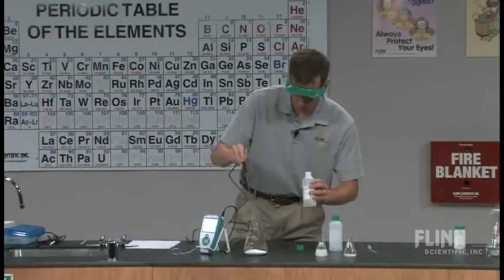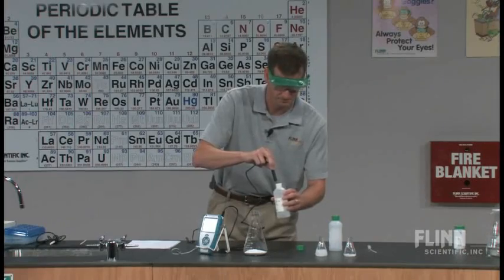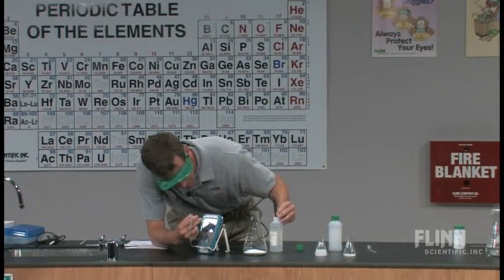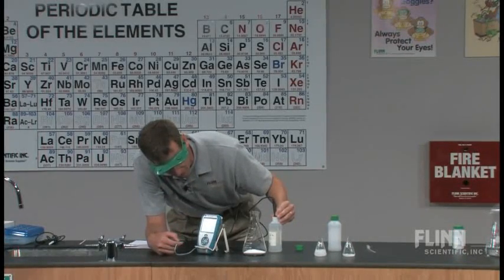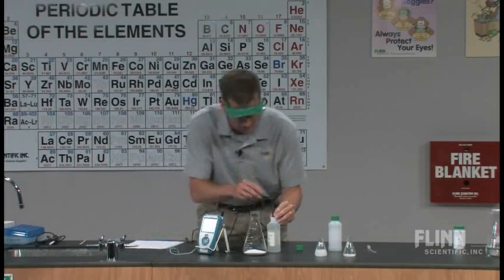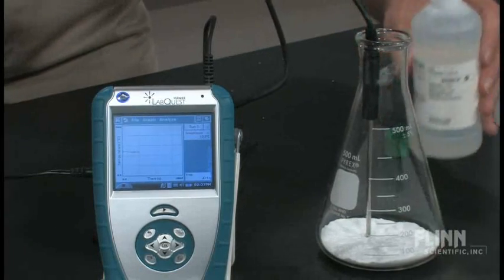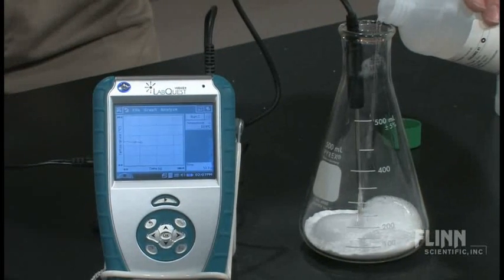We'll take the vinegar and put the temperature probe in the vinegar — that's going to give us an initial temperature of that vinegar. So that vinegar is at about 23.9 degrees Celsius. I'm going to switch back to my graphs now — it's taking data for me right there. I'm going to take my temperature probe and put it down in my baking soda. And I'm going to slowly pour the vinegar into that, and we'll see what happens to that graph as we add the vinegar to it.